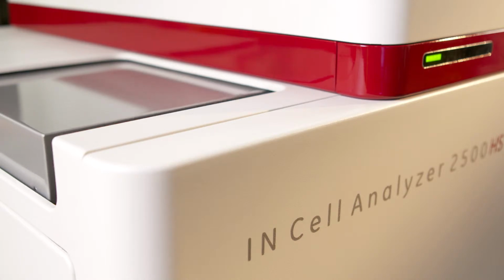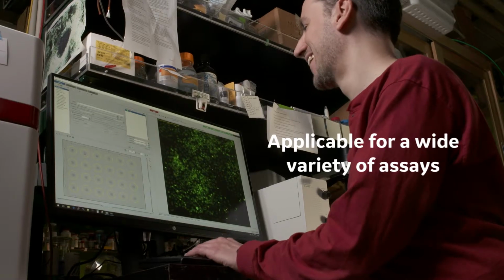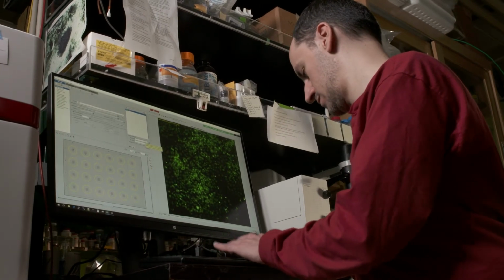One of the things that we've just started using the InCell and the software for is to identify and find our CRISPR cells. So cells that we have modified so that certain proteins are expressed with a fluorescent label. And one of the things that's a little disturbing to a microscopist is that sometimes we can't see them. And so they're invisible, even though they're at endogenous levels. So we have been using the InCell to find our little colonies of CRISPR cells, and it's fantastic.